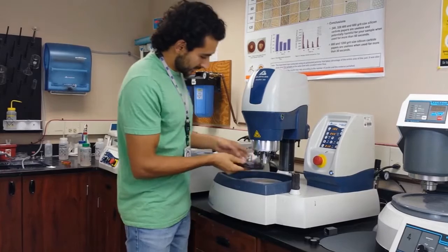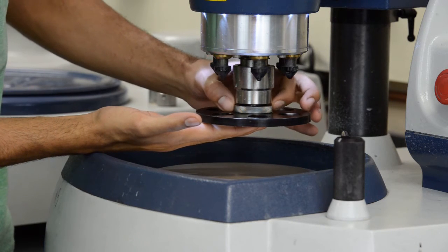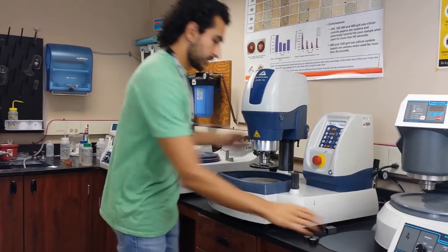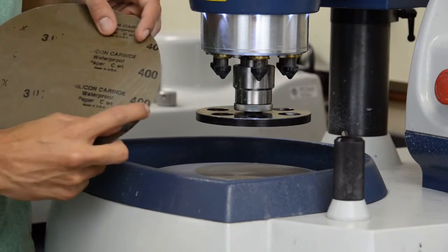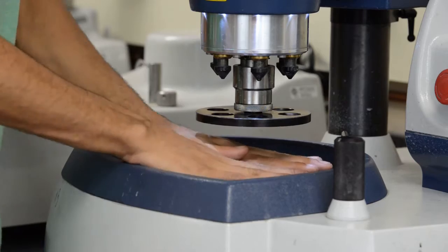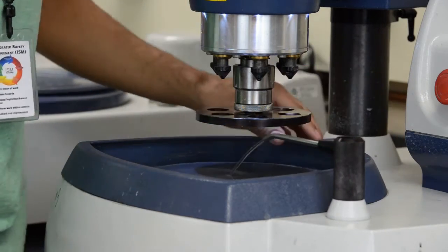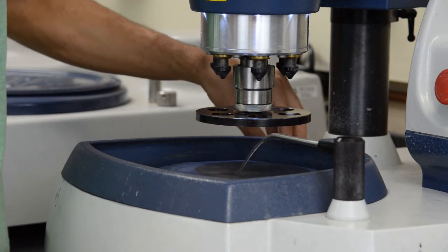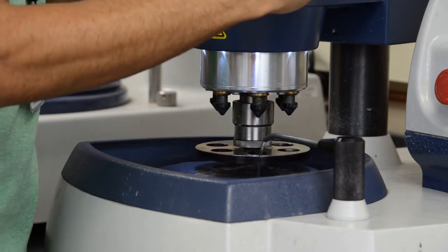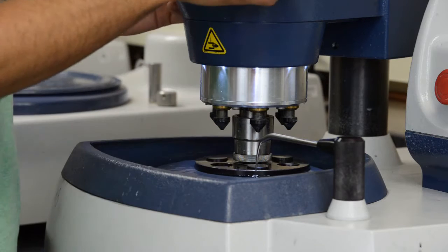Alright, it's clean now. To put the plate on, you only have to lift this, put it in there — you can rotate it slightly for stability. Now I'm going to take a piece of 400 grit silicon carbide, peel the backing off, and put it in place. Get it wet first — you want to get it wet. Stop it, get the amount of water you actually want — not too much, that should be enough. Press the button, let it go down and then up, put your samples in — one, two, and three — and here it goes.